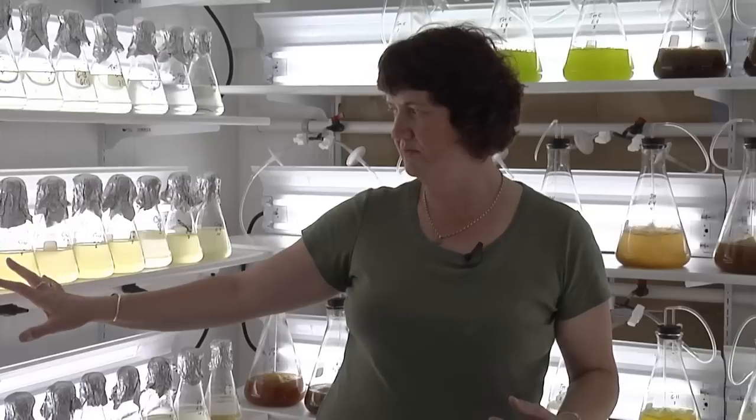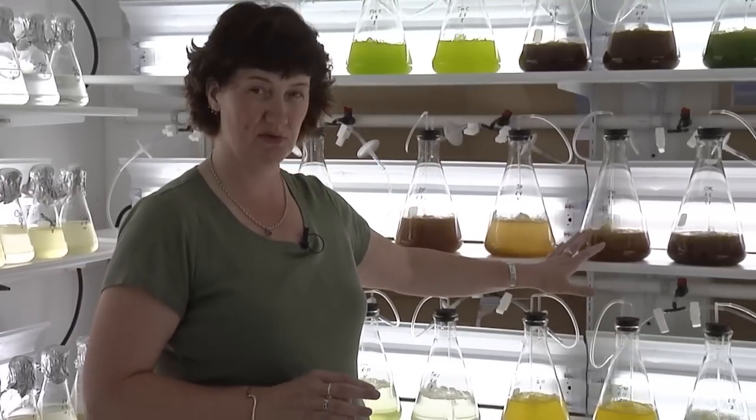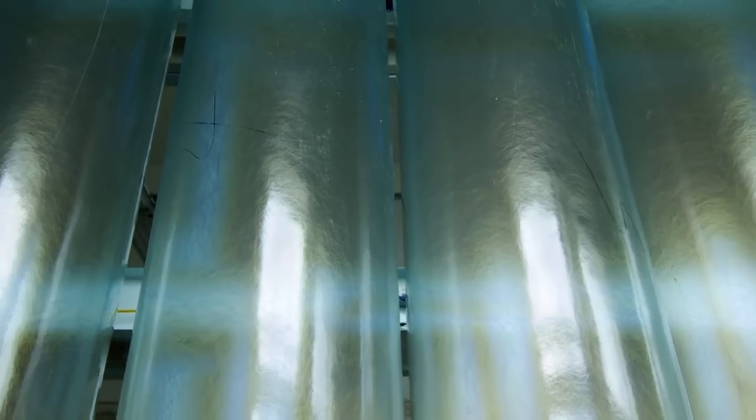After the small flasks have grown for about 4 days and they're transferred into the large flasks, which they'll grow for about another 4 or 5 days, then they will be transferred downstairs into the big tubes of water.